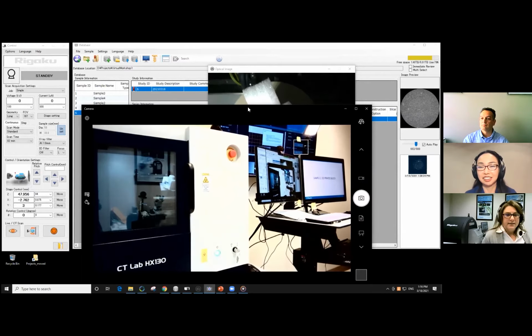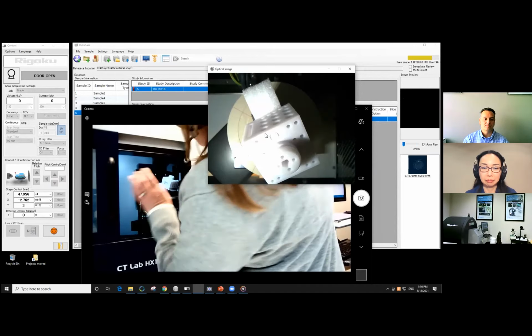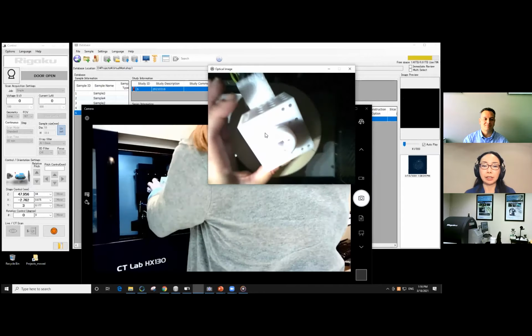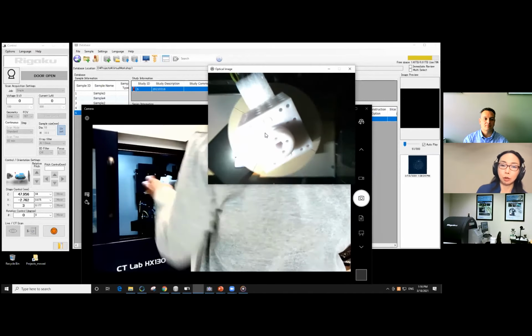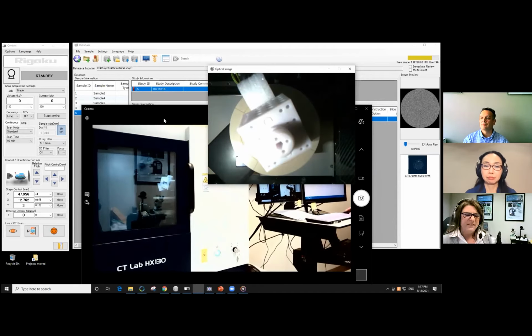All right. Talking to the sample. Sometimes I do, and I get really upset when things don't work out. So I find it helps. Now it's really off center, so I'm just going to talk to myself a bit and ask myself to maybe center these. You can use better that sample camera inside of the machine to center it when you do it, right? Right. But my field of view is a little larger than the actual block in this case.